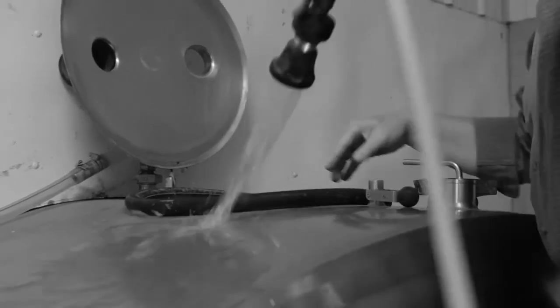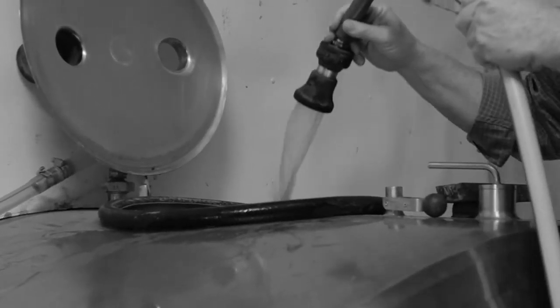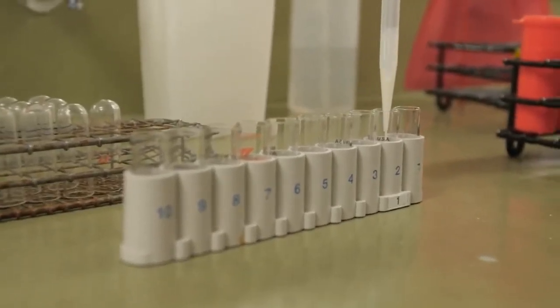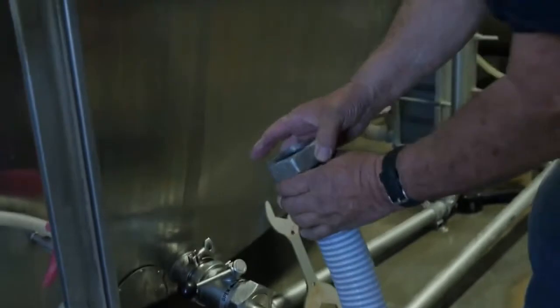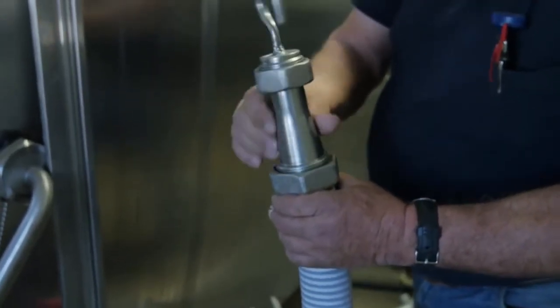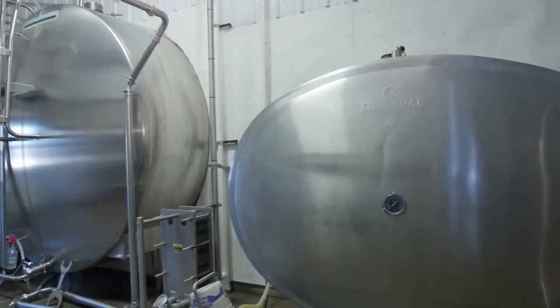Adding water to milk is an illegal adulteration of the product — it falsely inflates the amount of milk in a load. Tests for added water are based on the principle that milk freezes at a lower temperature than water; when water is added, the freezing point becomes closer to that of pure water. To avoid adding any water, make sure the transfer hose is disconnected before you rinse the bulk tank. Also, if ice water leaks into sample containers in your storage container, this will produce a false result, making it seem that water was added to the whole load of milk.